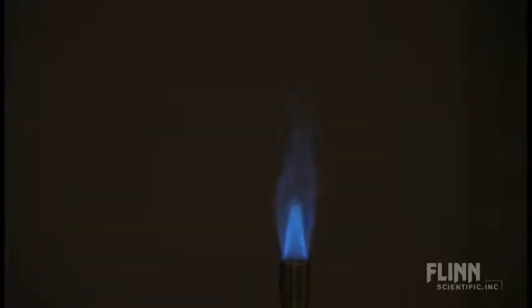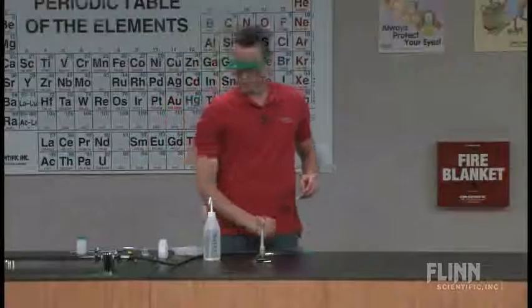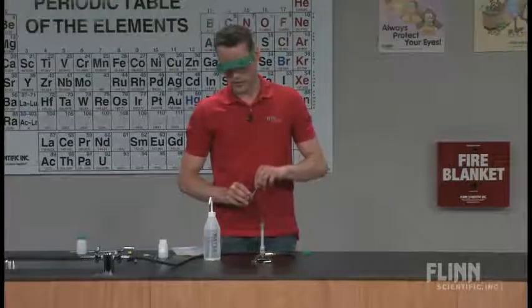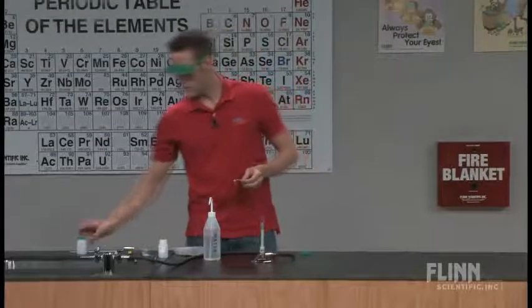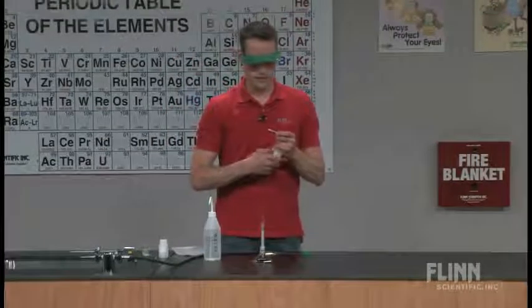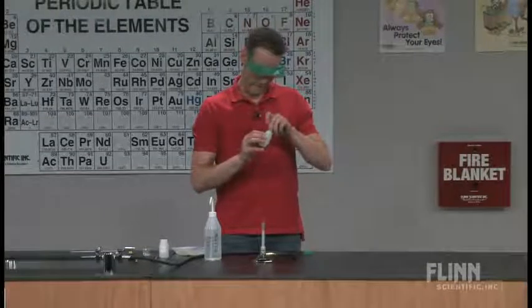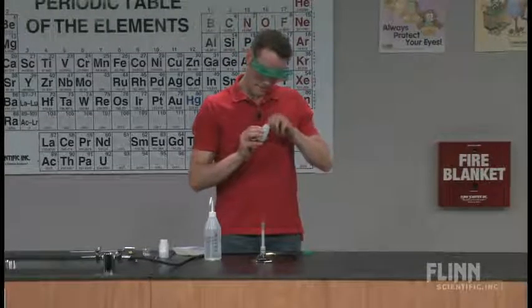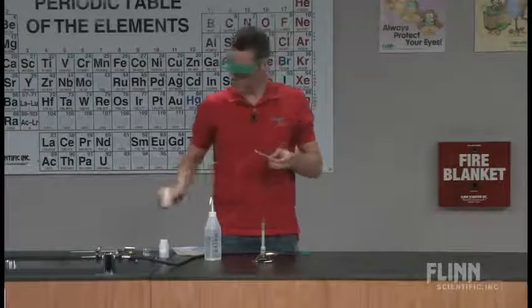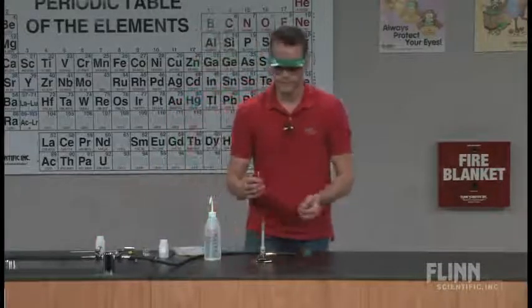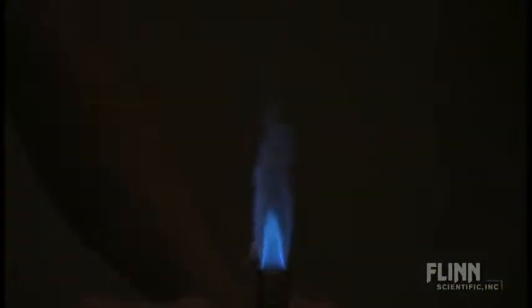I'll repeat the same flame test with potassium as well. And same procedure, just dip in a little bit of water, wipe off any extra, and then dip it into your potassium salt. And if we dim the lights one more time, you can see that the potassium gives a pale lavender color.